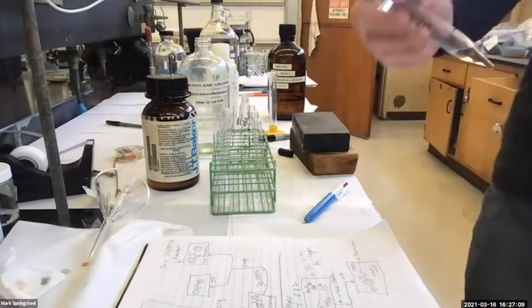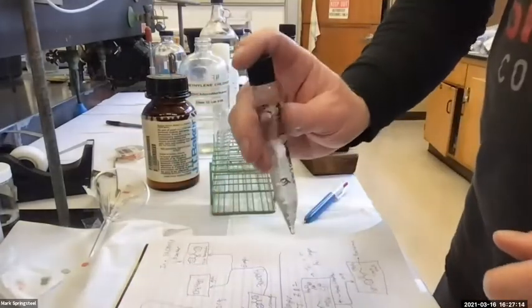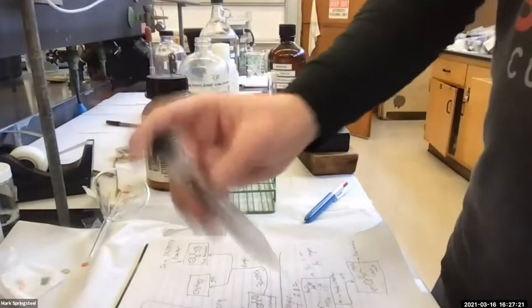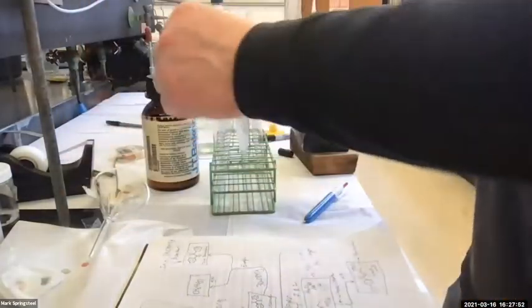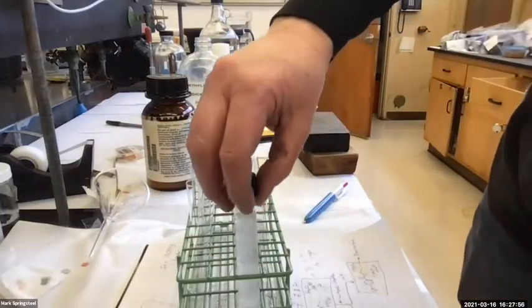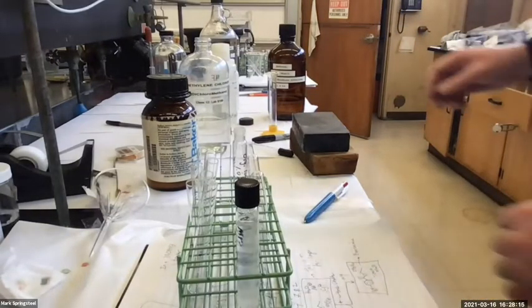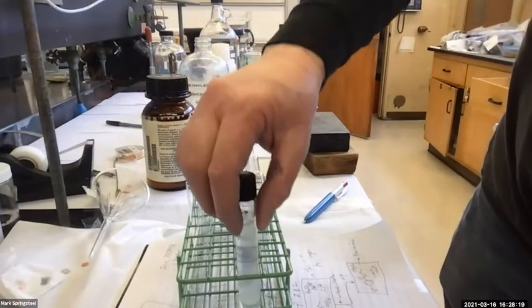Okay, slight tilt. Vent, yeah, this one's not venting too much, we're good. Give it a real good shake. Okay, that's pretty good. So what I'm gonna do is let you watch it separate. I'm gonna go glance at our evaporating beaker over here, see what it's looking like. Yeah, it's evaporated a little bit. It's looking pretty good. This guy's separating out well.